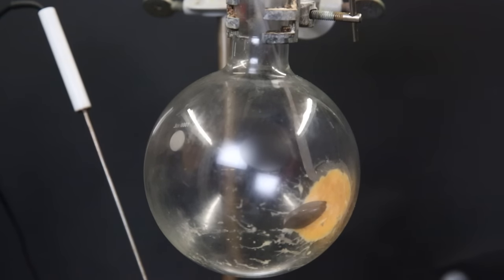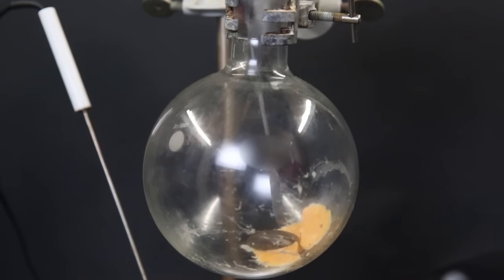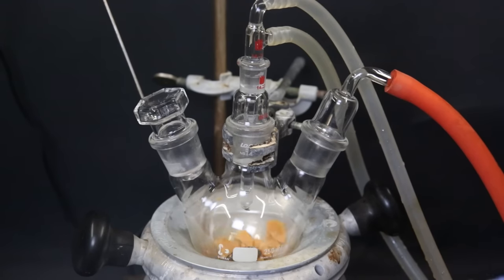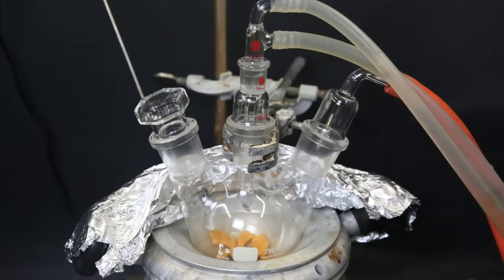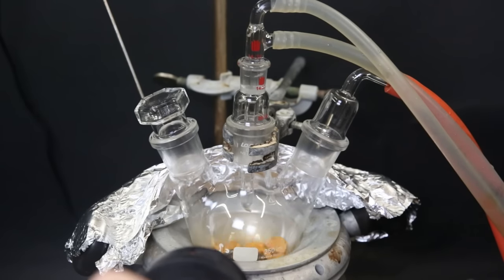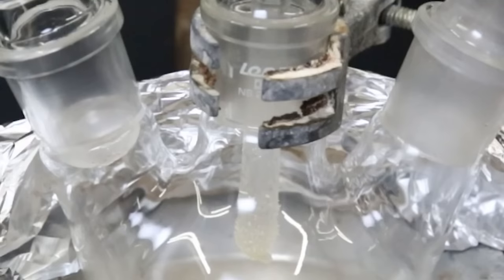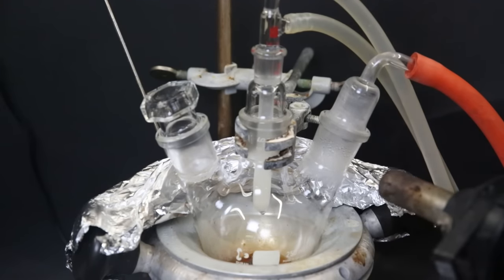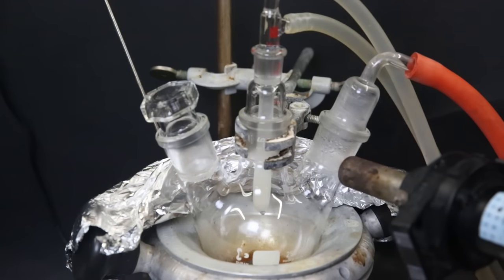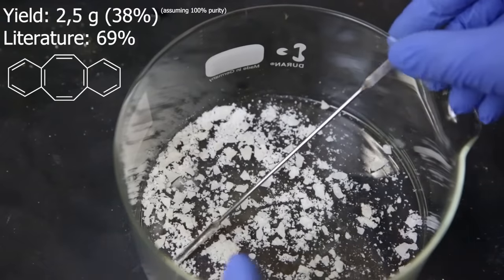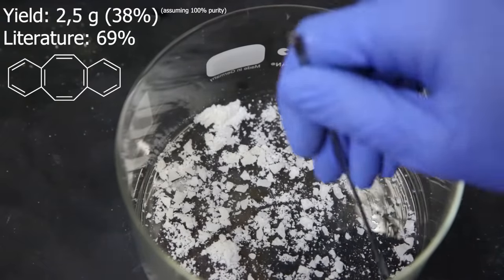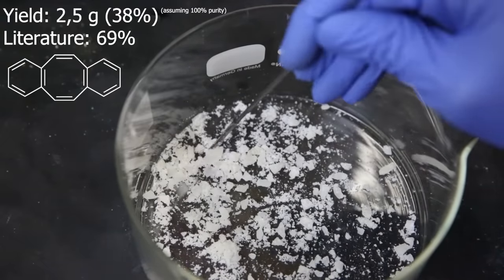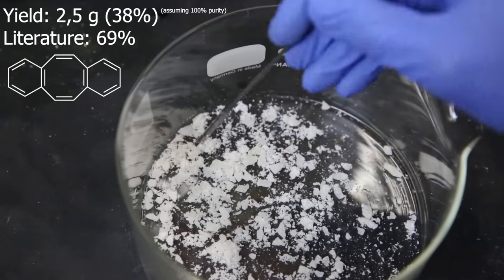And I was left with a yellow-orange solid. I poke at it a bit, and it breaks easily. Now for the final step, I transferred all of the solid with the stir bar to another flask and attached a cold finger and a vacuum adapter. Now I will attempt the exact same thing as earlier in the video, but now with the final product. So I pull a vacuum and start heating and stirring. After a while we can see crystals are starting to form on the cold finger. There was also some other impurity present, which started refluxing in the flask. Though it will likely continue to be present as an impurity because of this, it seems like it doesn't wash away the crystals or interfere with the deposition. So after it is done, I scraped all the crystals off, and I am left with 2.5 grams of dibenzo[a,e]cyclooctene, which is a yield of 38% compared to the first product.